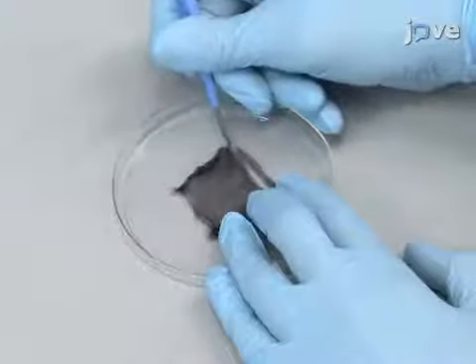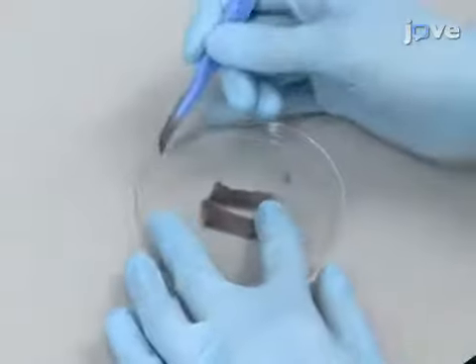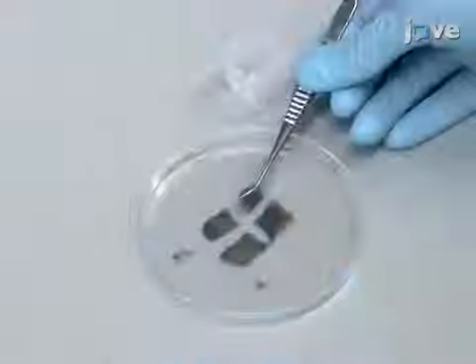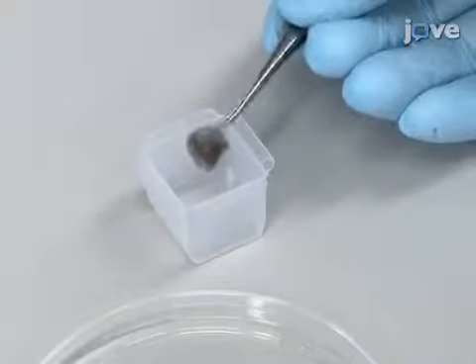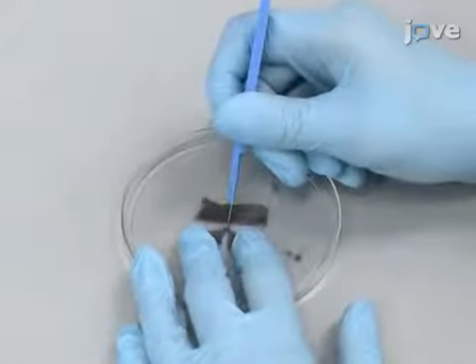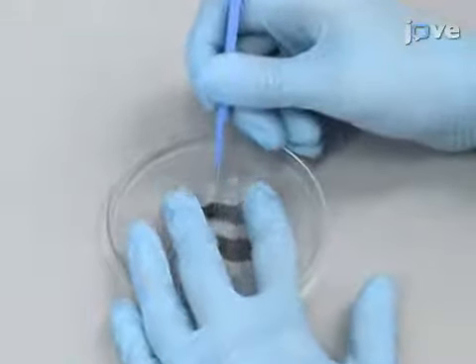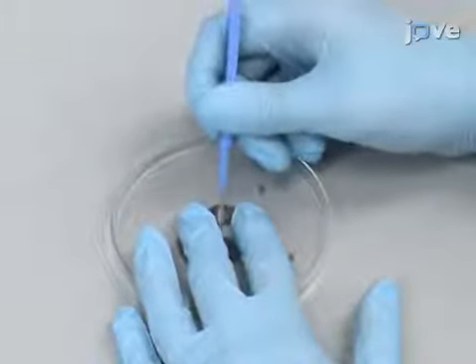Begin by trimming skin harvested from the dorsomedial region of a mouse into rectangular pieces. Each piece should be sized to fit in the bottom of a cryomold. A 1 square centimeter area of dorsal skin, which fits into a 22 mm by 30 mm by 20 mm cryomold, is demonstrated here.